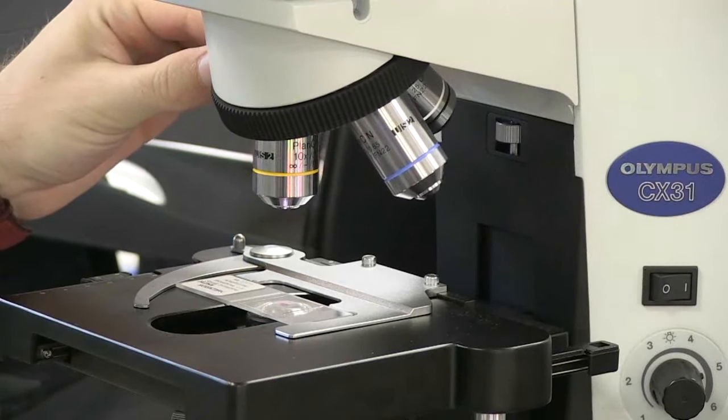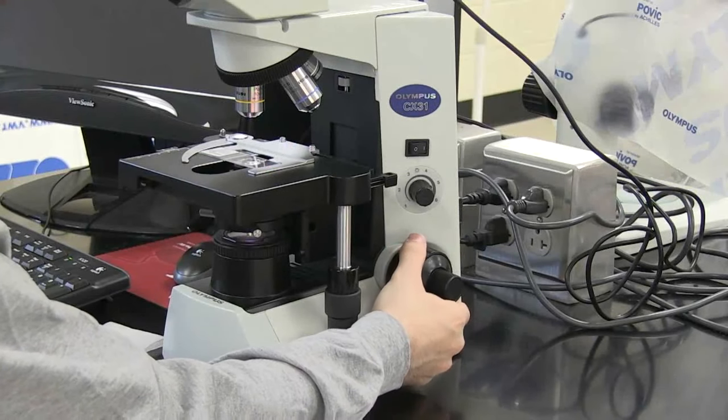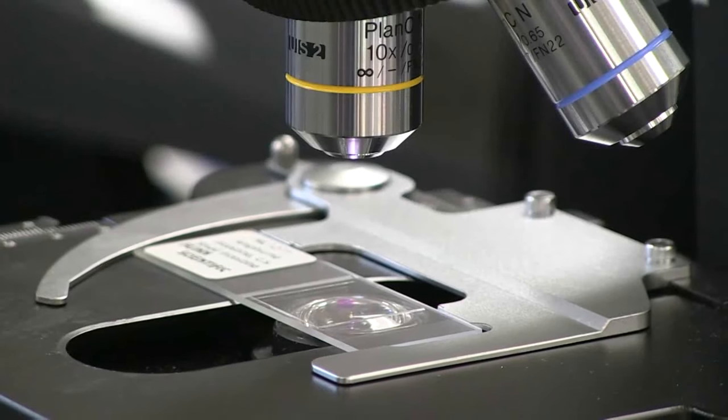Turn to the 10x objective. Using the coarse focus adjustment knob, raise the stage.